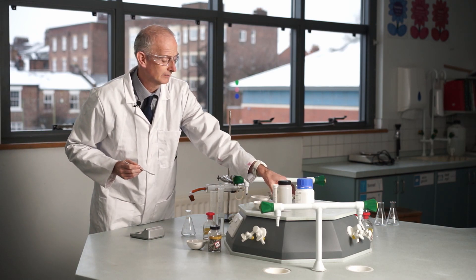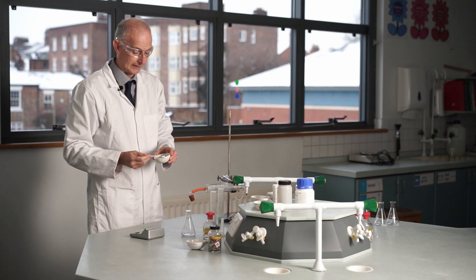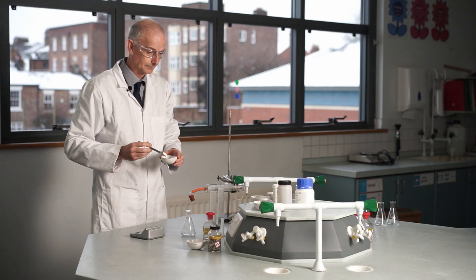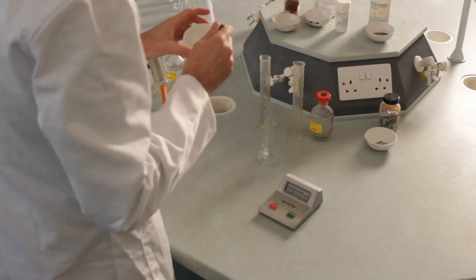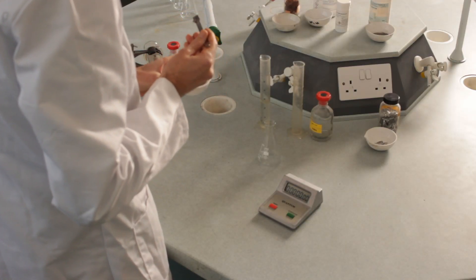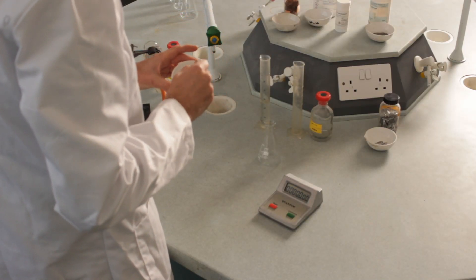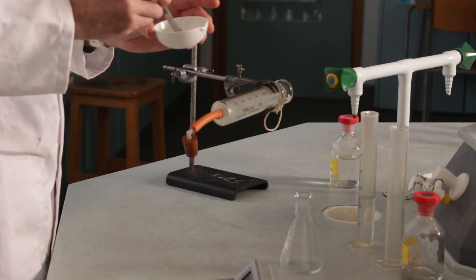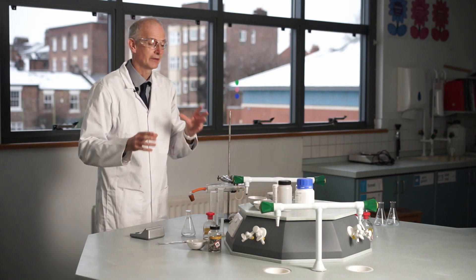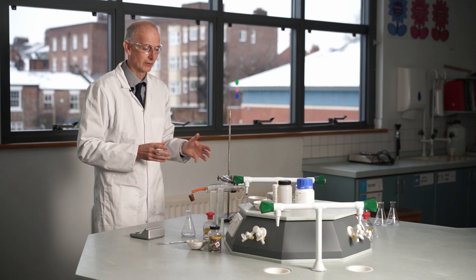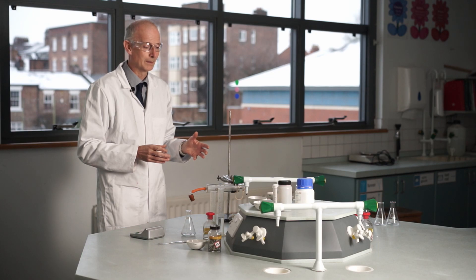I've got the same for zinc. So this is a zinc powder, again quite a fine powder. And then here I've got some calcium, which is little lumps of calcium. Not a fine powder, not a foil, but little granules, if you like. So we're going to try each of these separately with 25 centimeters cubed of acid and see what the volume of gas is given off after one minute.